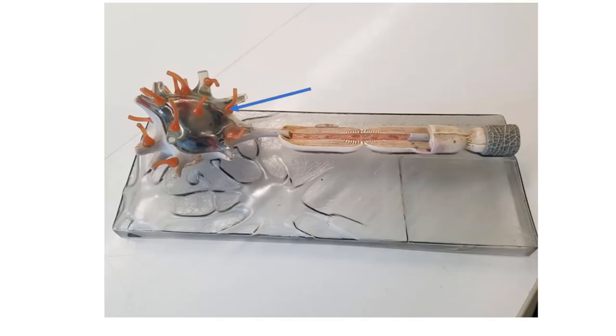What we're going to do in this short lecture is go through some of the lab models and microscope slides associated with nervous tissue. So you'll see some of these again as we get into the brain and spinal cord also, but this is just for the nervous tissue section. So this is a model of a multipolar neuron. I just want to go through some of the anatomical features that you can see.